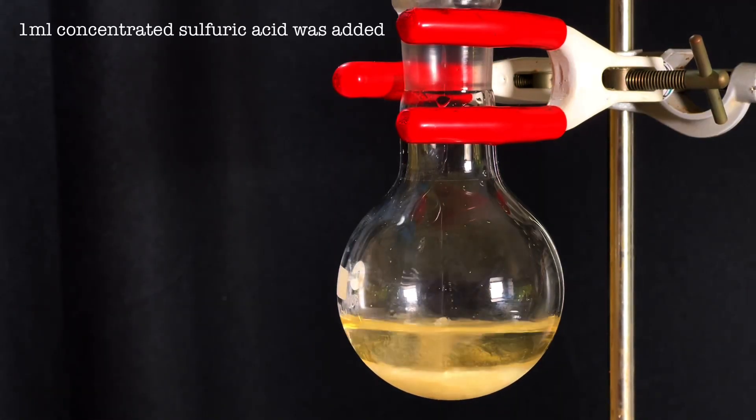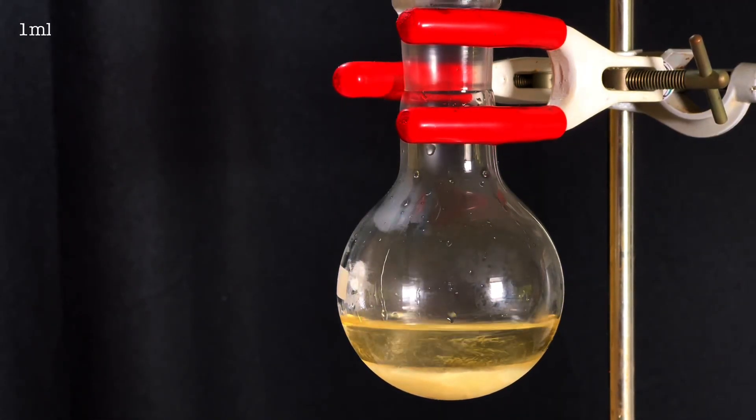Next add 1-2 milliliters of concentrated 98% sulfuric acid. This acts as a catalyst for the esterification.